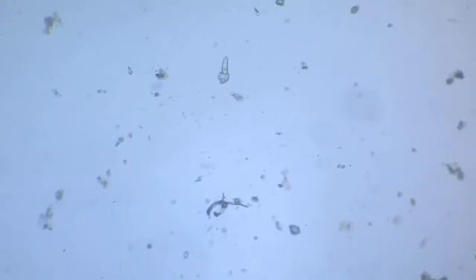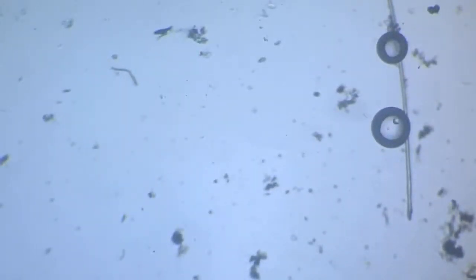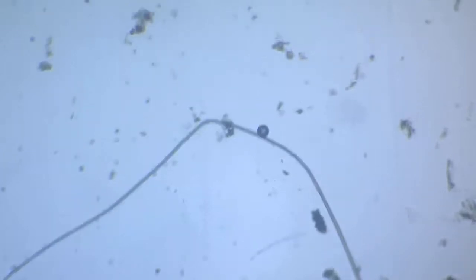So now we again try to search for our little fluke fellow. Where is it gone? Must be on the slide, has to be. There's a little small space that he can proceed, or there's no way through which he or she or it could escape. There is another rotifer.